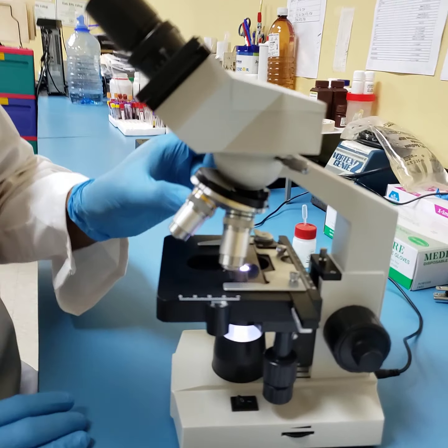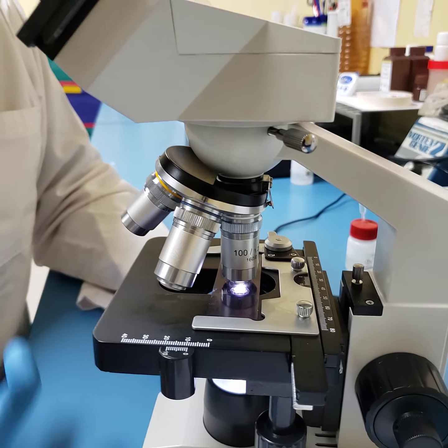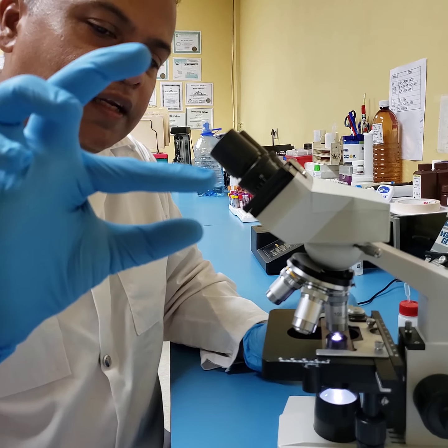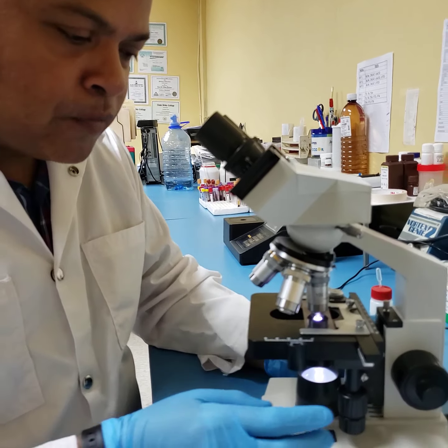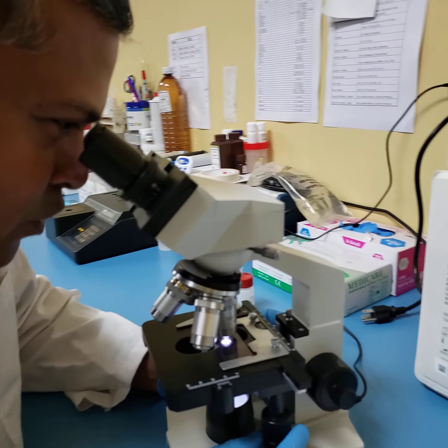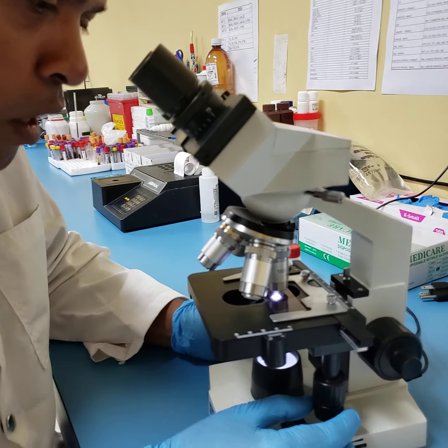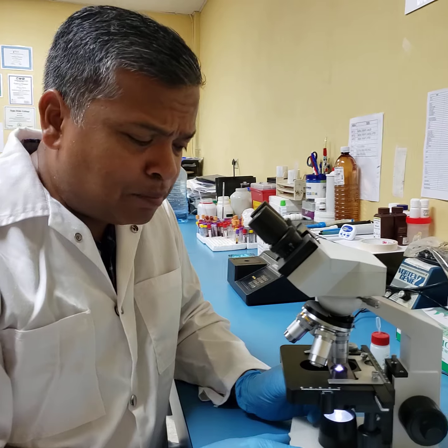Then you turn your nose piece in a clockwise direction, and what has happened here at a microscopic level, the lens, the 100 magnification lens, has formed a continuity with the oil, and then the oil has formed a continuity with the image for clarity. Now we come back again, we use our fine adjustment knob, and there now I have my image that is very big and clear. Now remember, initially I told you guys about condenser and aperture.